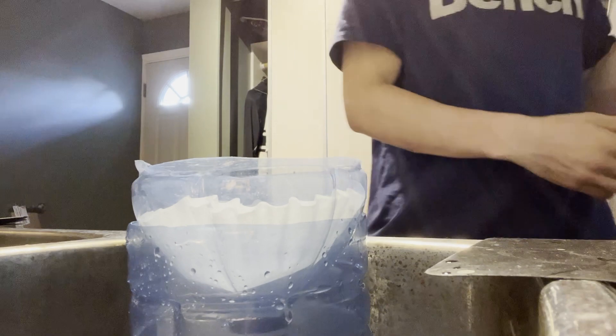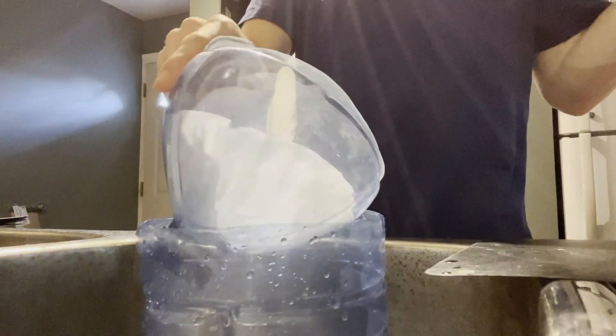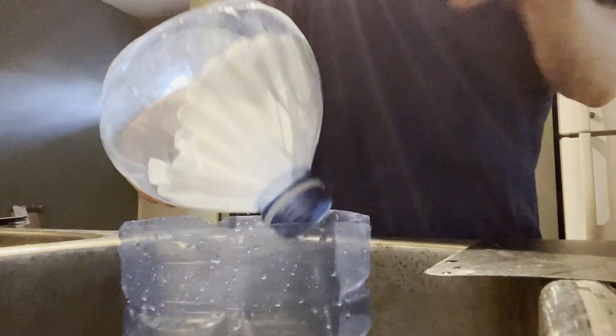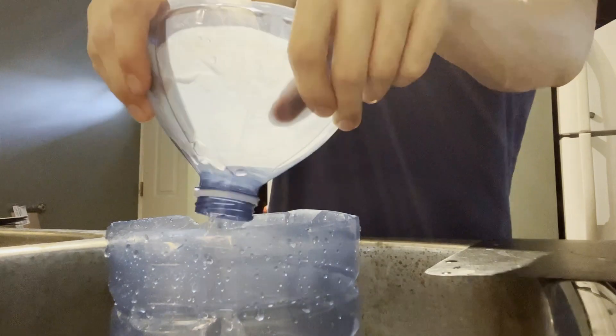After being thrown in the freezer and going down to about zero Celsius, I take it out and I decant off the top of the liquid and then filter the rest of it. Here, I'm just wetting the filter paper so that it filters out easier.